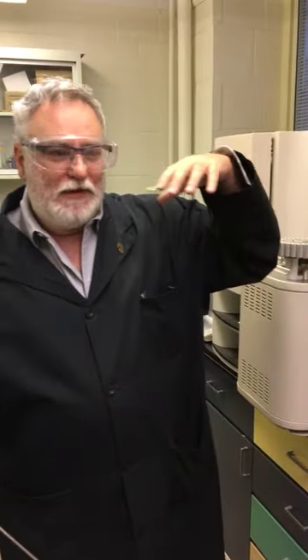the conditioning runs here are, I run it a couple of times where I don't actually put the sample in. It gets the furnace at the right temperature, it gets the infrared sensor warmed up, and we sweep any sort of contaminants out of the system. This doesn't take much to do. It's on all the time, 24 hours a day when it's working.